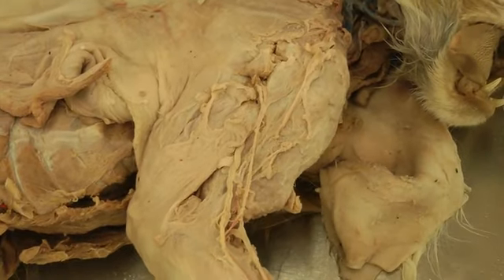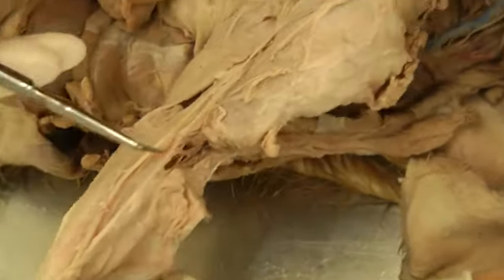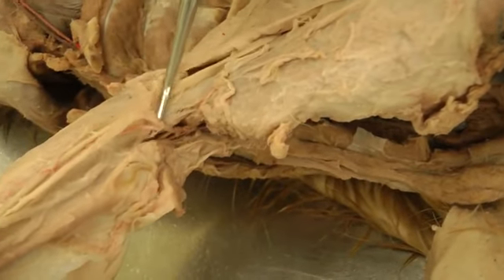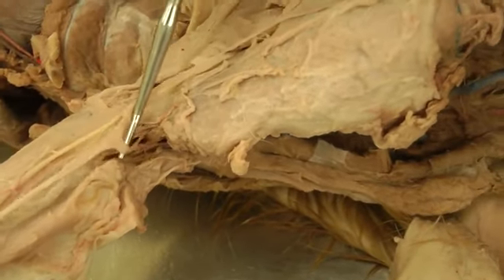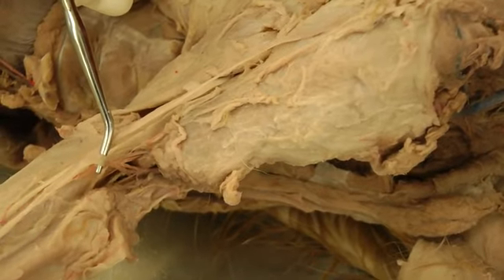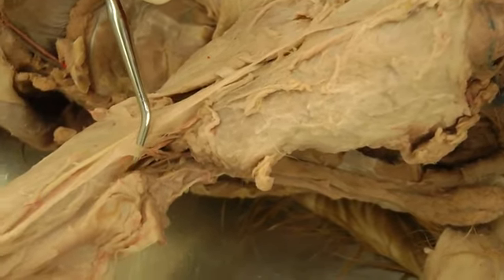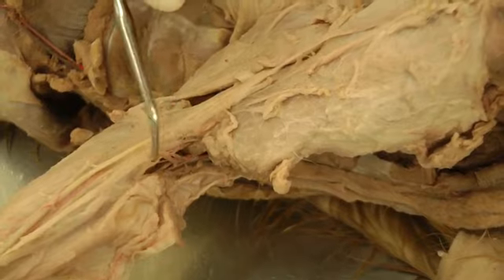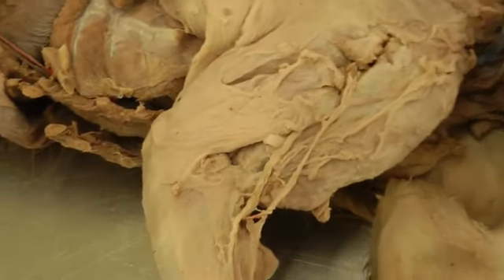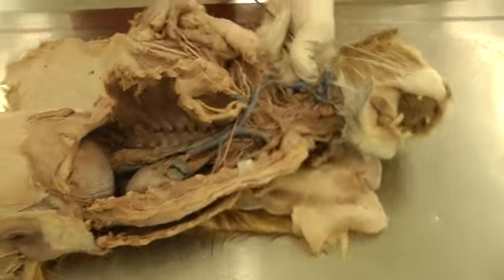The median cubital, however, still shows up right here — connecting your brachial vein and your cephalic vein. So the median cubital is in between those two. Now we'll move on to the arteries and nerves.